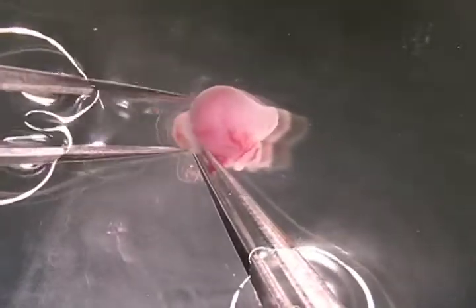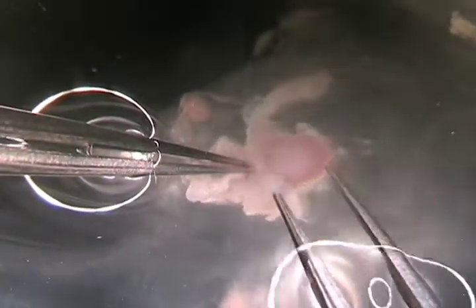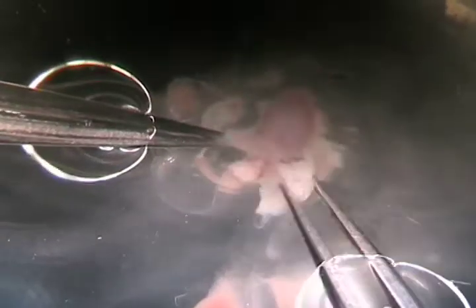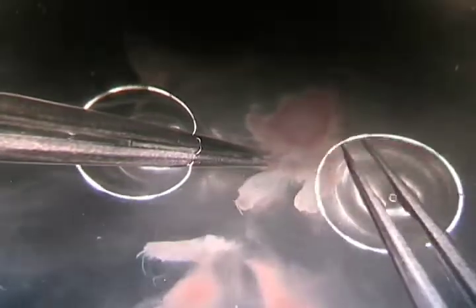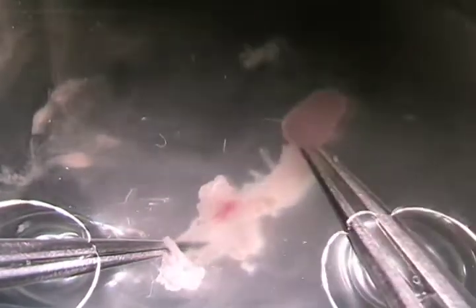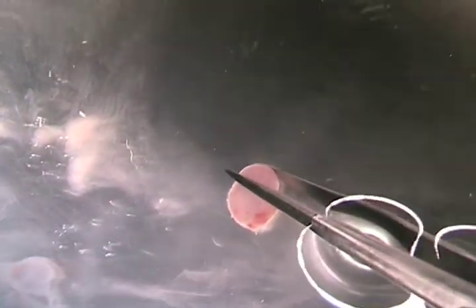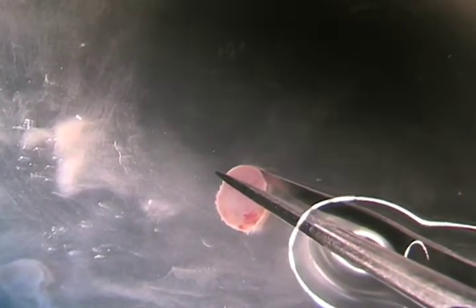You can just grasp the embryo on its side and basically pry it apart. At this point you're exposing the deciduum, which is a more spongy tissue underneath. So the embryo should be right in the middle, right here. This is the apex of the deciduum, so you want to orient it facing up with the apex.